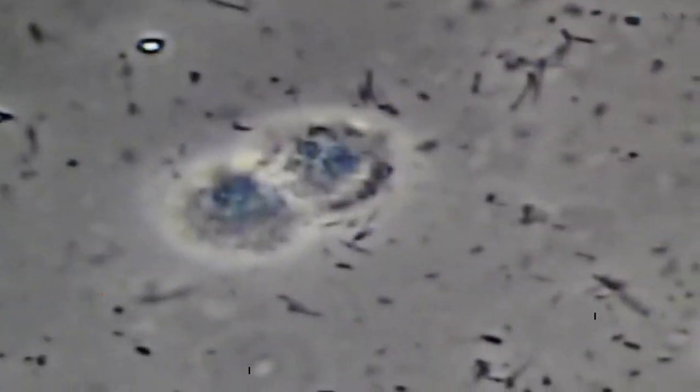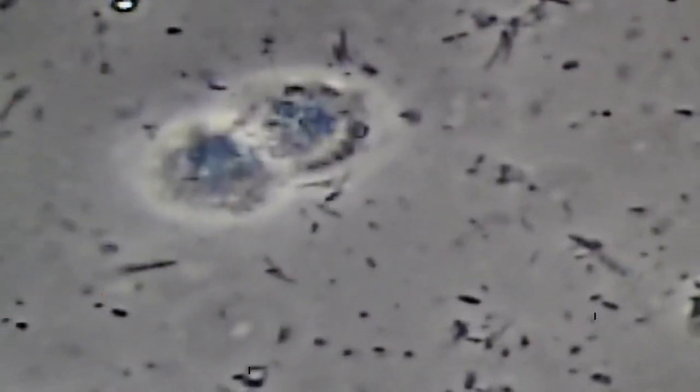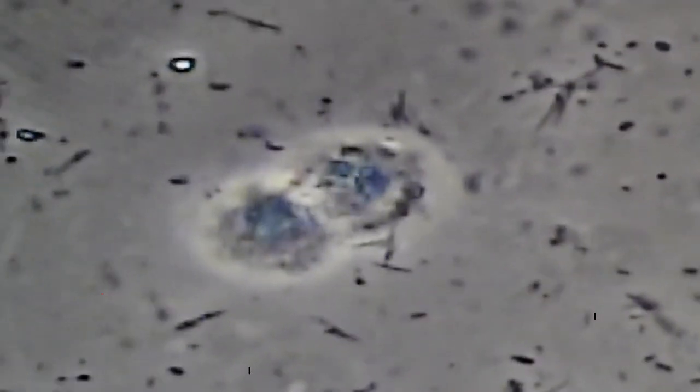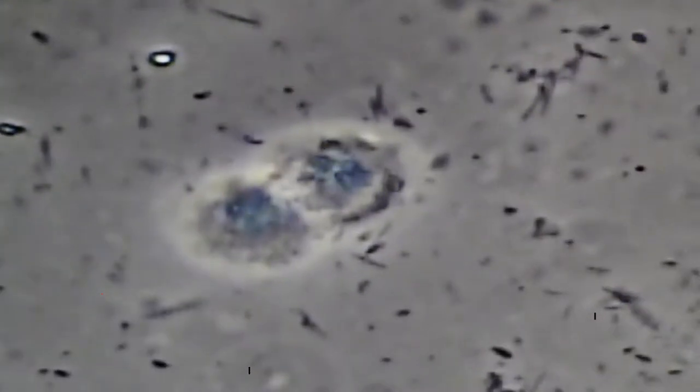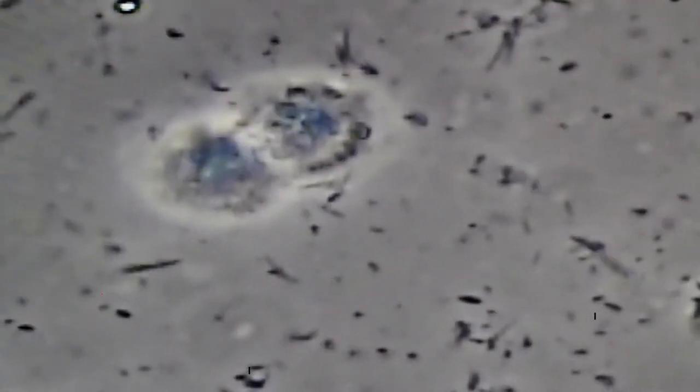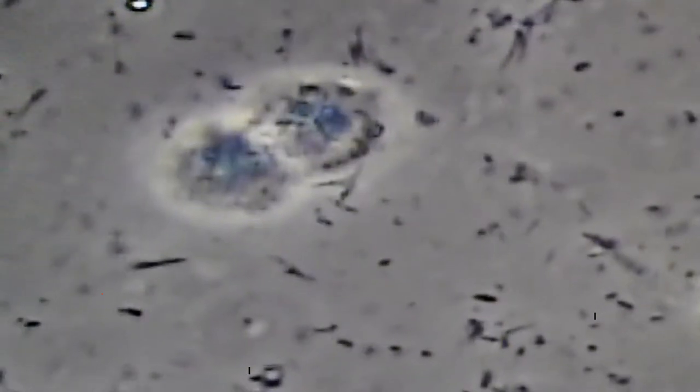Here's a fairly typical looking slide. Near the center are two large circular objects — those are white blood cells. Surrounding them is bacteria that you can see in different forms: some are little dot-shaped bacteria, cocci as we call them, and short rods. You'll see some rods that are kind of spinning around.